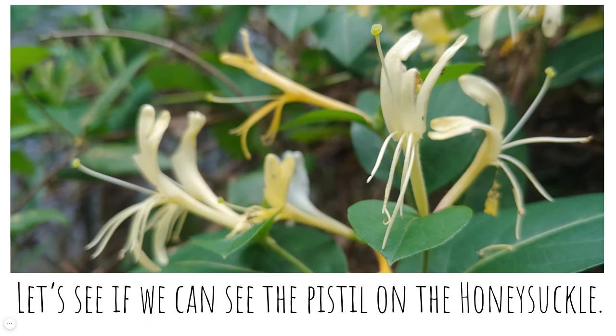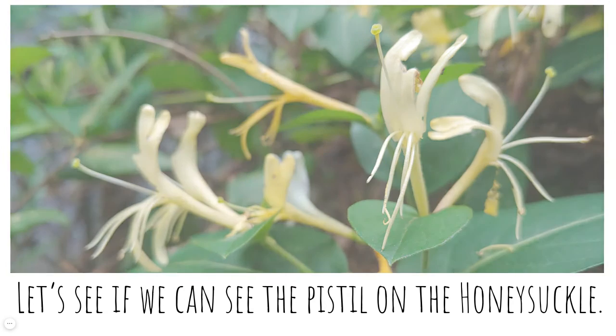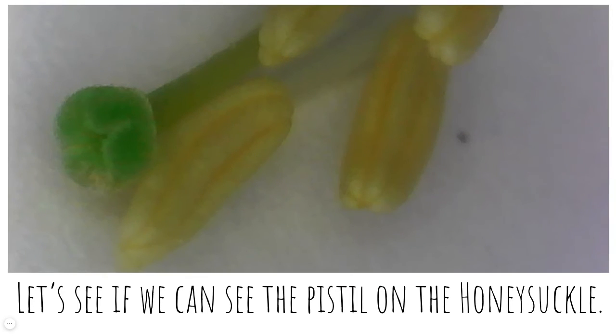Let's see if we can see the pistil on the honeysuckle. I can see it in this picture. Can you see it? Yeah, it's right here in the middle. It looks a little bit different in the honeysuckle than it does on the spiderwort. Let's look closer. So here's the pistil of the honeysuckle, and here are the stamen, the part that makes the pollen. Yeah, each flower is different.